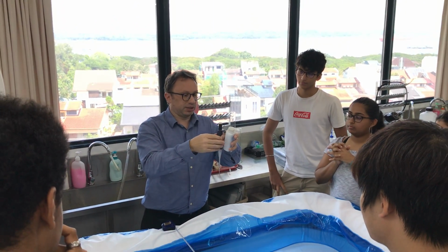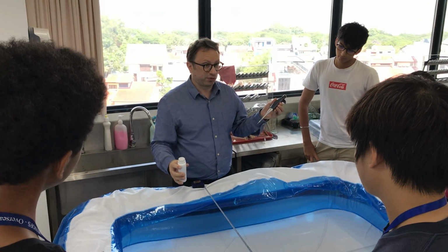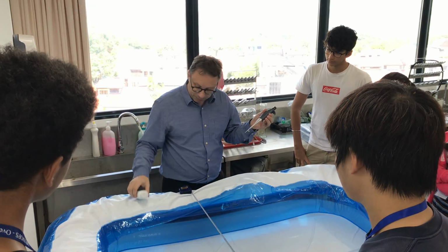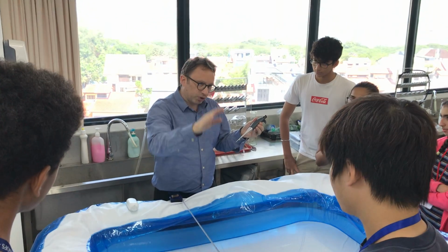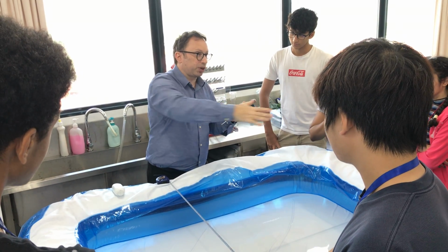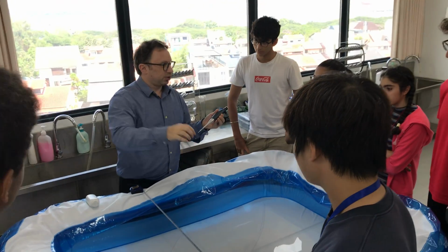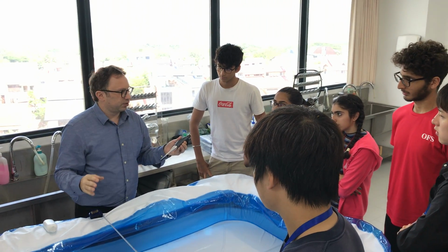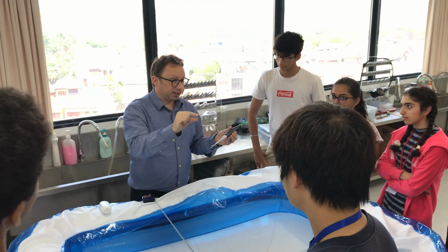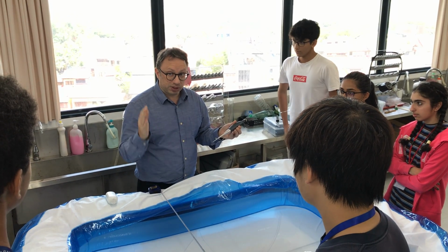Now the idea is, and interestingly, this was an experiment done by Benjamin Franklin. He used some oil in a pond, but what should happen is, as the drop of oil hits the water, the molecules will tumble over each other and will start spreading out until you get a single layer of molecules. So it's spread out, hopefully in a bit of a circle, and that should be a monolayer, 1 layer thick.